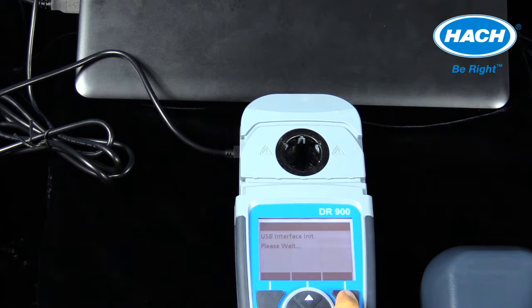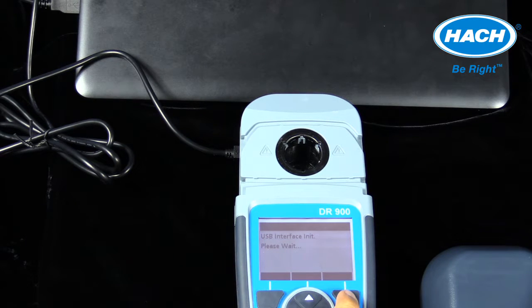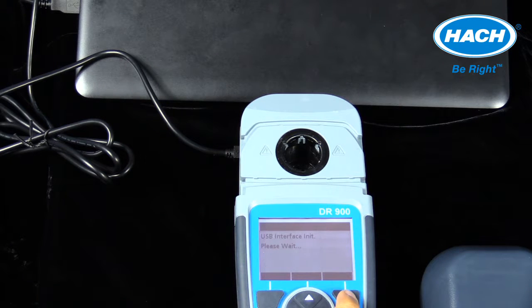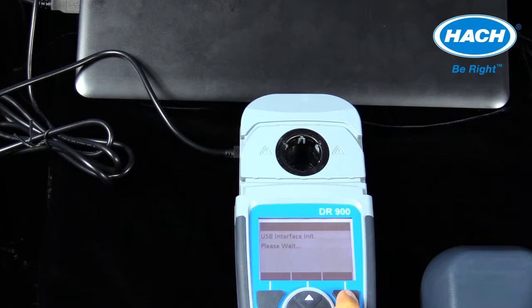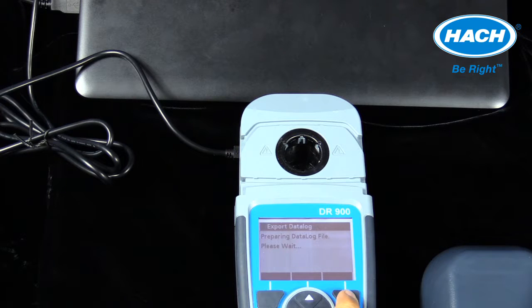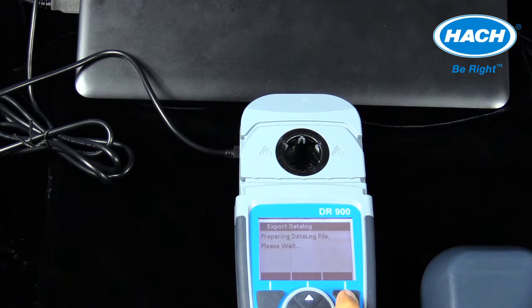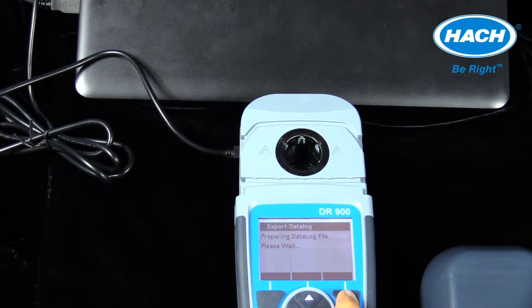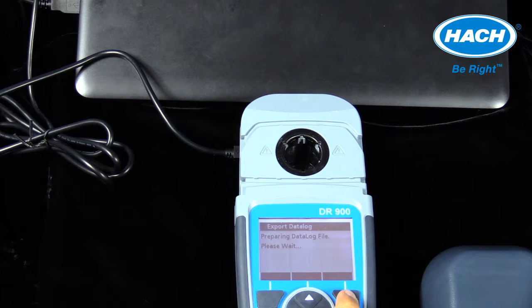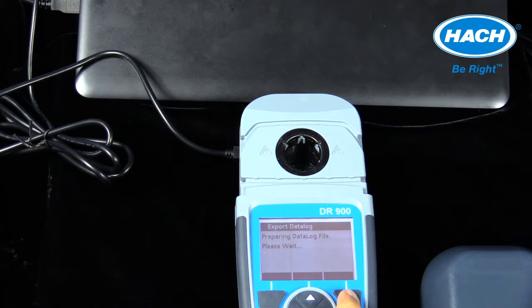The meter will display USB interface initiation, please wait. And then the meter will display preparing data log file, please wait. Upon completion of preparing and exporting the file, the meter will display file exported as a data log .CSV file.